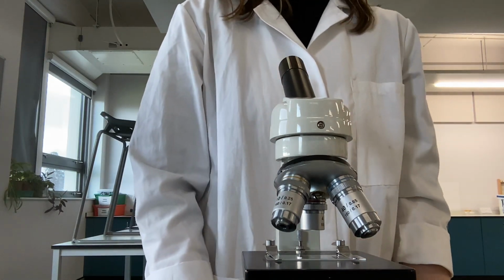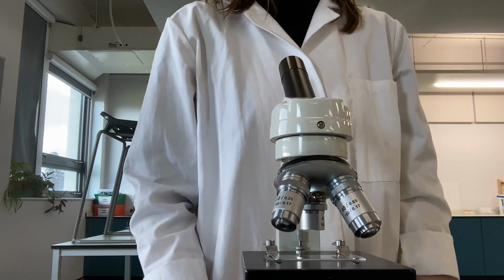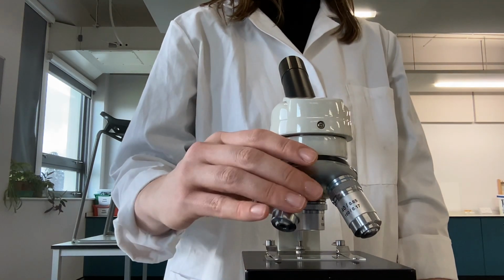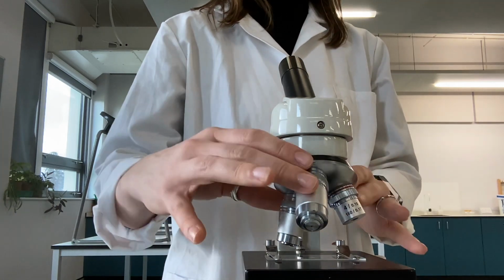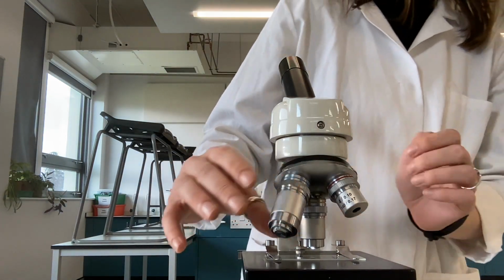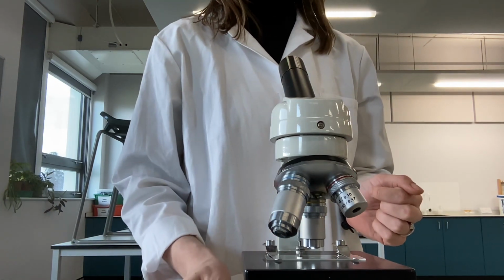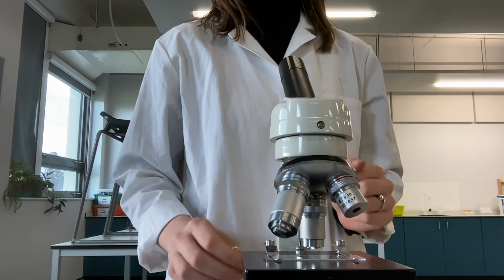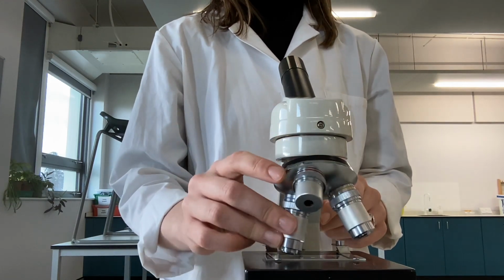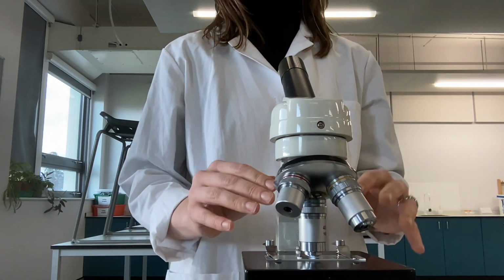If you are unsure of how to calibrate the microscope, there are instructions in the PAG guide, and there is also a video that is already online giving a tutorial on how to calibrate microscopes. Once you have done that for the ×4 magnification, you will need to leave the slide where it is, turn the objective lenses around until you have the ×10 objective lens above it, and you will then need to refocus the microscope and calculate how much each eyepiece unit is worth. Again, once you have done ×10, you will then turn to ×40 magnification, leaving the slide where it is. You're just changing the magnification.